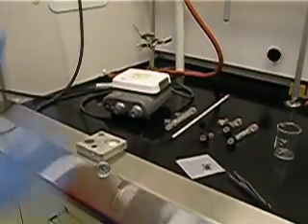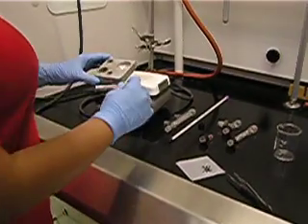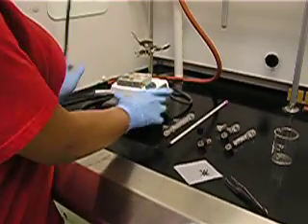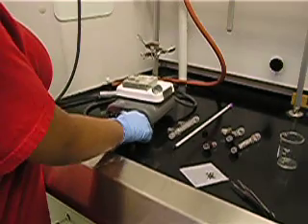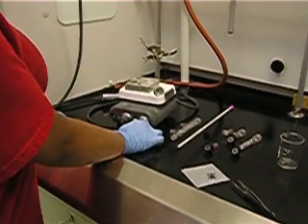First, we find our aluminum block and set it on top of the hot plate. Turn the hot plate on and adjust it to the appropriate setting and let it begin heating.